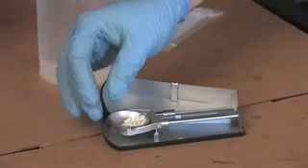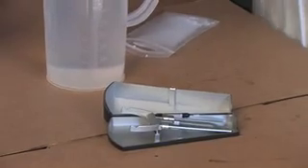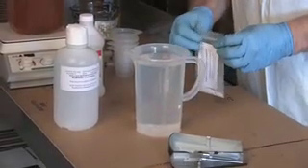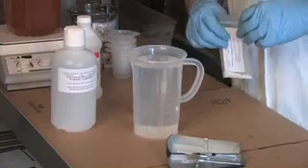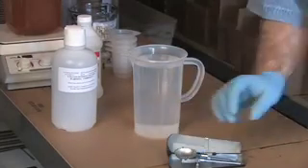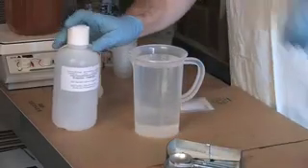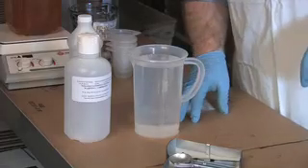We've got a gram. We're going to take this gram of our catalyst and introduce it to our water, then allow it to dissolve. It will take a little bit of time. Sodium hydroxide takes forever to dissolve, by the way. One of the reasons I like to use potassium hydroxide is that it will almost dissolve on contact.